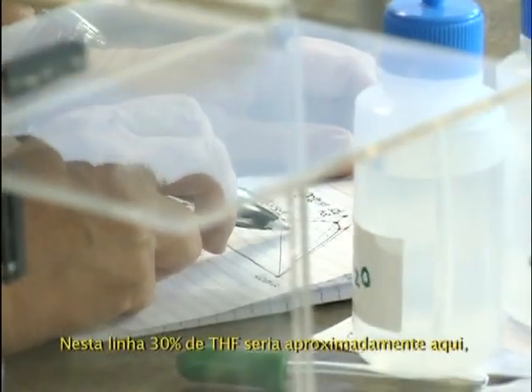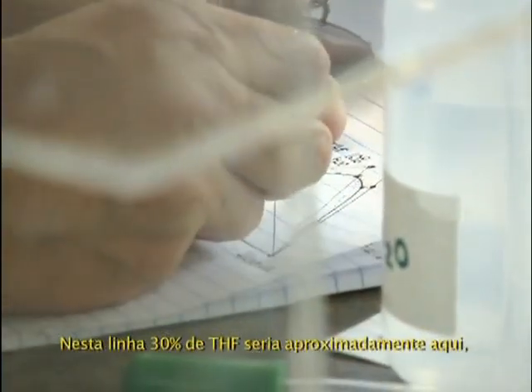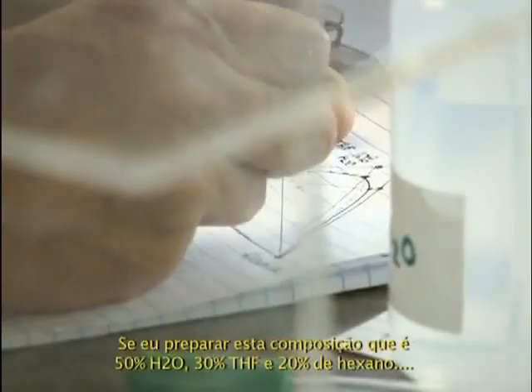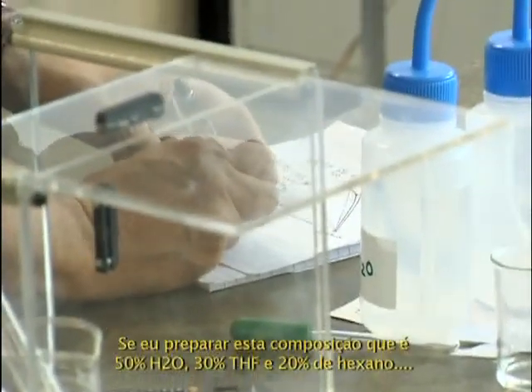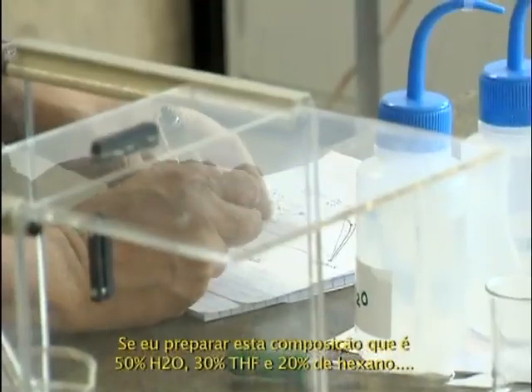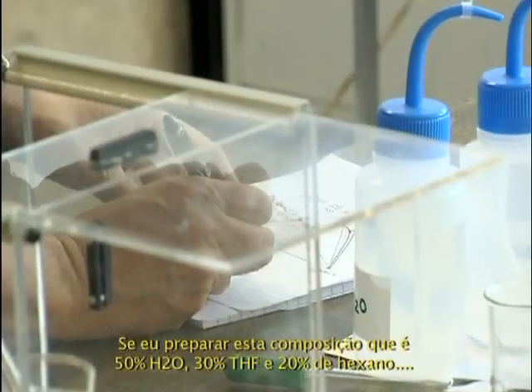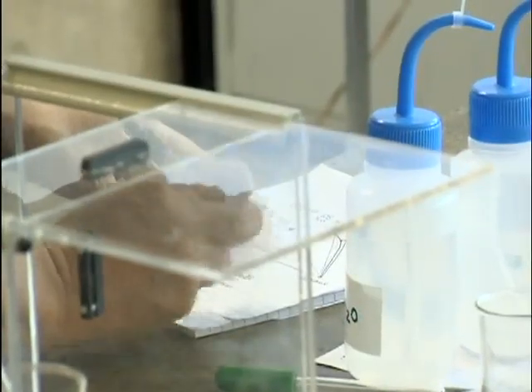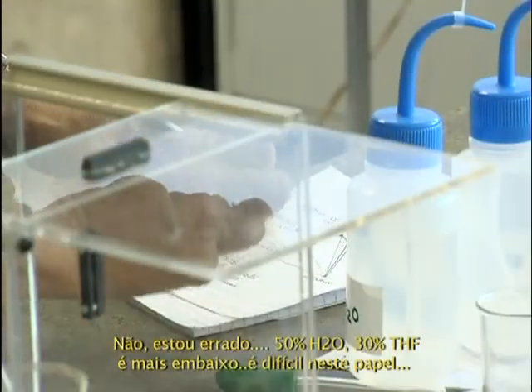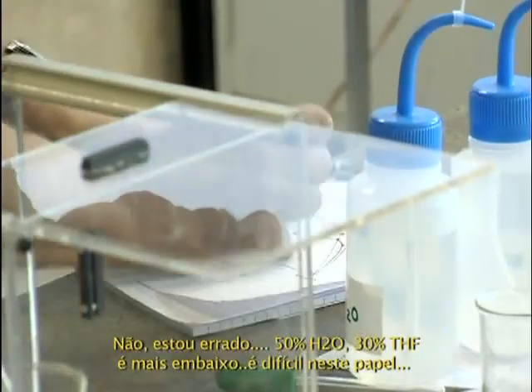On that line, 30% THF would be approximately here. If I prepare this composition, which is 50% water, 30% THF, 20% hexane. No, I'm wrong. 50% water, 30%, it's lower.